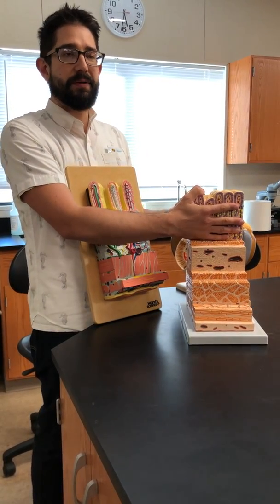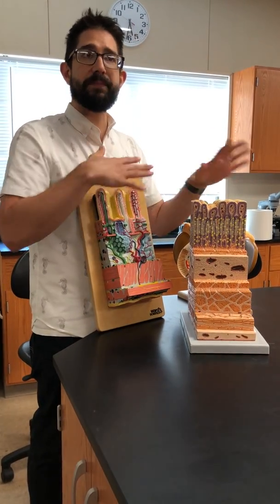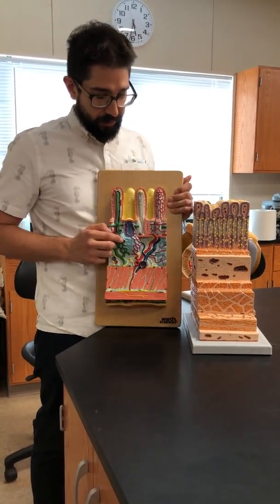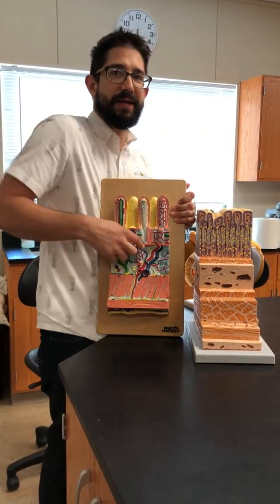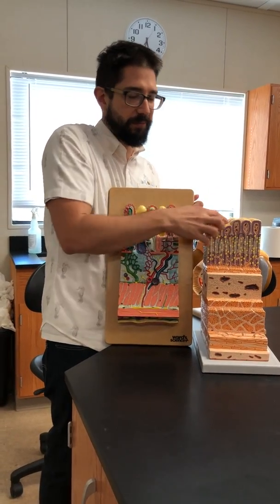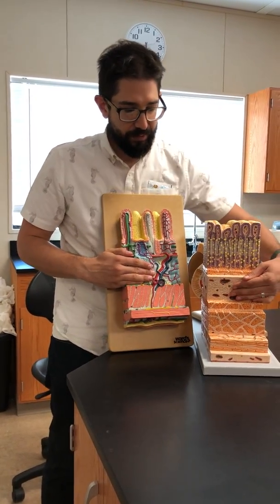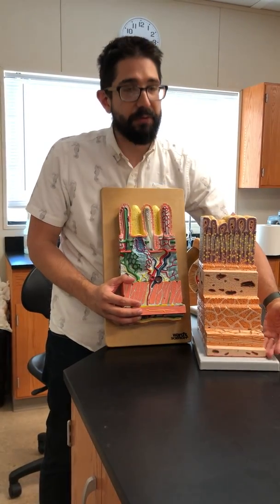I know where the mucosa layer starts and ends because I can envision this as the lumen, the inside of the chamber. But also I can find the muscularis mucosae. The mucosa ends with a thin muscular layer to help nudge stuff that might get stuck or trapped. It's just a small muscular movement. So I find that, now I know that all that's mucosa. That must make this submucosa. Then this is pretty clearly muscular tissue, and that just leaves the serosa.